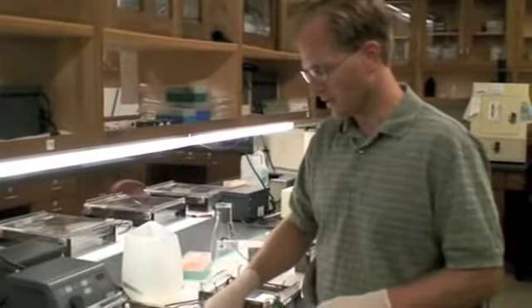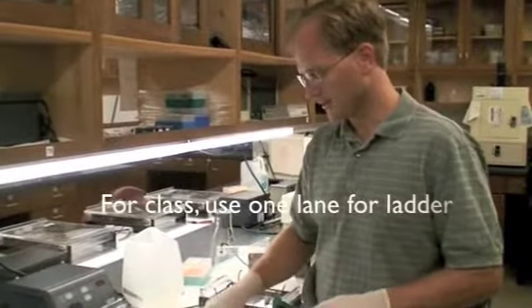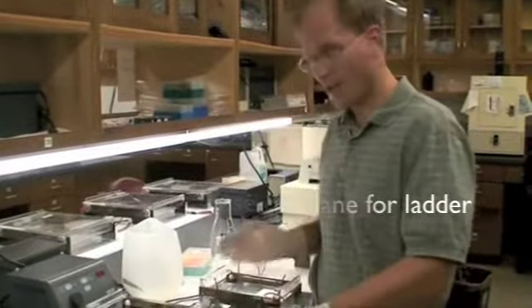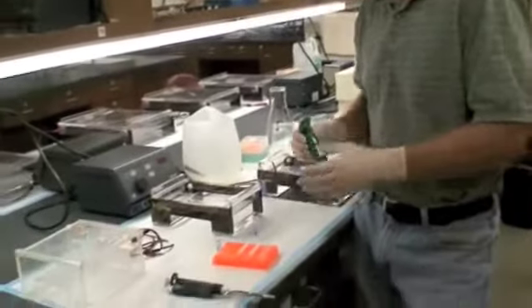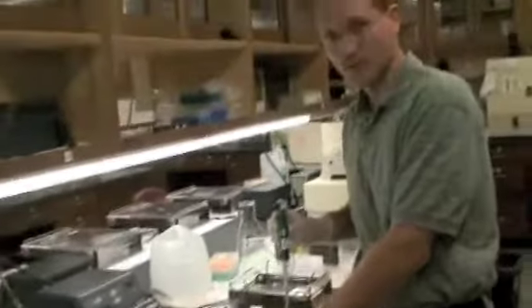One way to do that is to bracket the loading, meaning that I load this first. I'll load my samples, then I'll load one more lane of the ladder. If anything happened between those two time points when loading the ladder, I'll know that because the ladders will be different on either side.